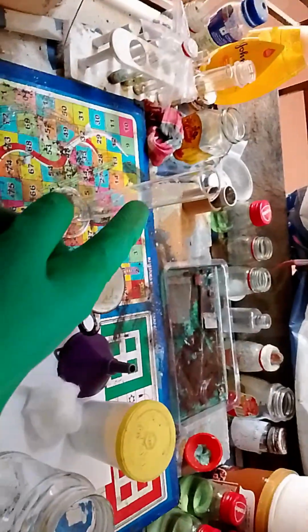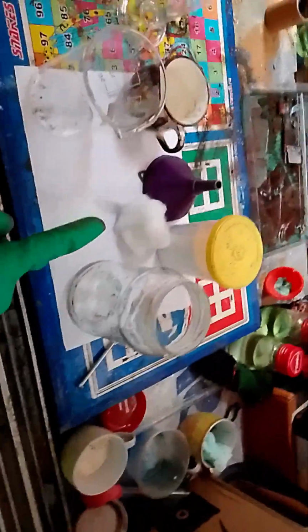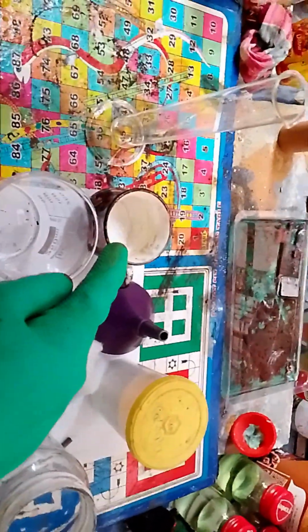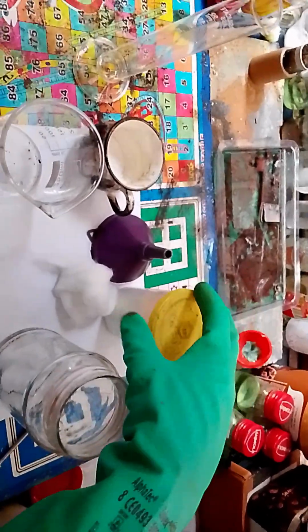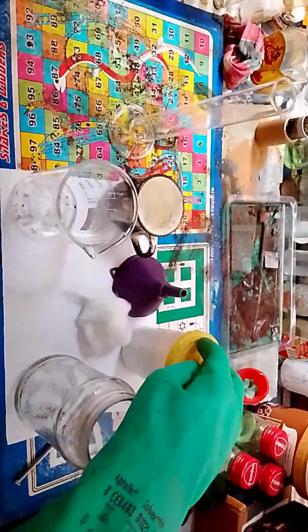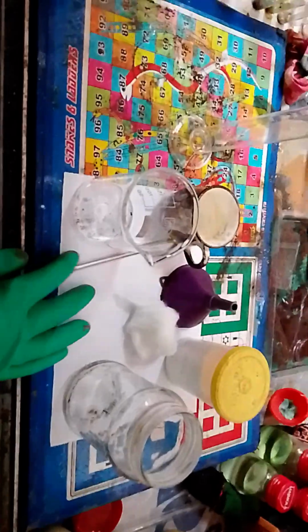Okay, what do we need today? We need a measuring cylinder, a beaker, our random jar, cotton, a filter funnel, sodium carbonate again, and this one is calcium chlorohypochlorite, the bleach we in India use as bleaching agent. I've also got a stainless steel stirring rod, which is actually a long screw. But I think it will be fine.